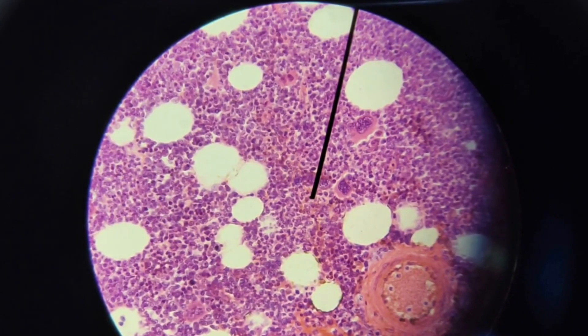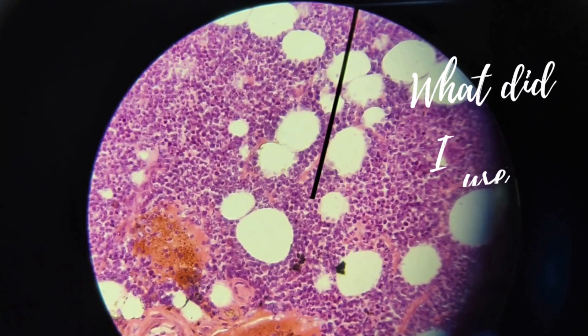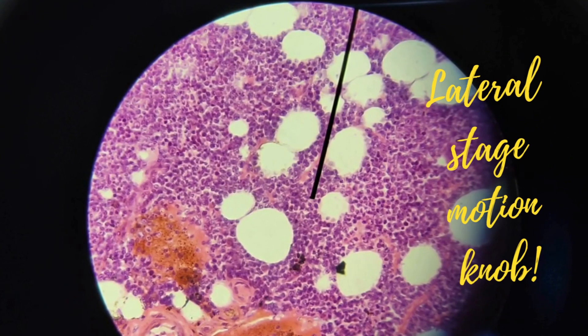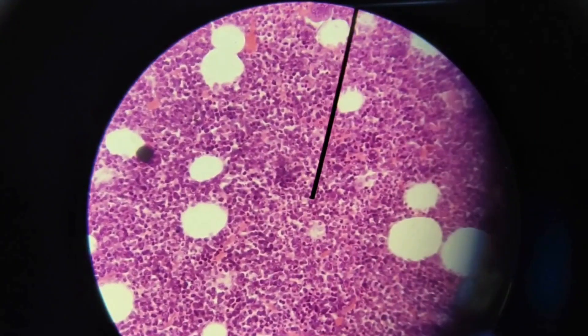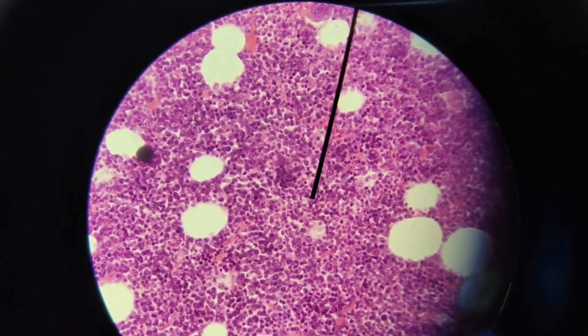If you want to move from one area to another, like what I'm doing, use the lateral stage motion knob to move the image. You could see it here. I could also use the longitudinal stage motion knob.